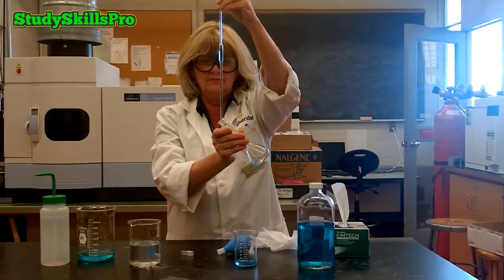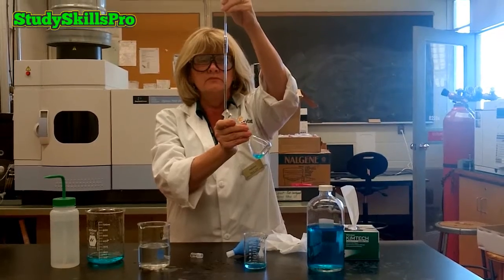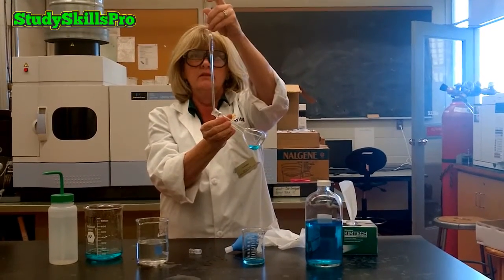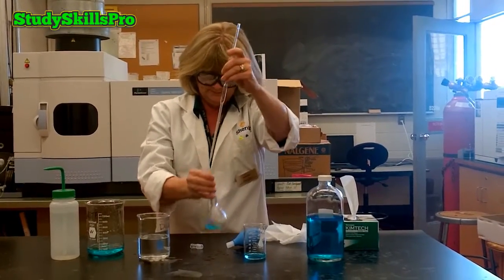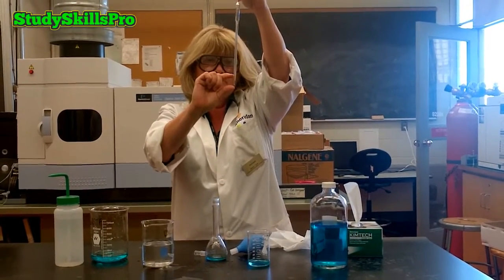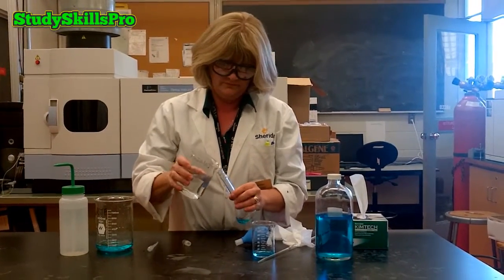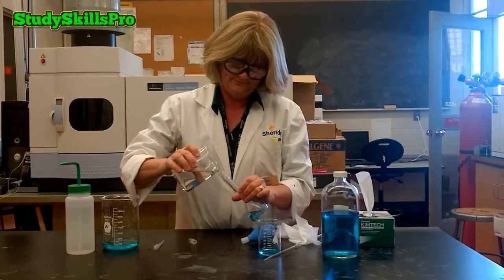In order to do this, ensure that the tip of the pipette is touching the side of the flask. And you will notice here that the volumetric pipette is vertical while your volumetric flask is held at an angle. At the end, you can slowly rotate the volumetric flask in order to ensure that the last drop from the pipette has been transferred into the flask. You will notice that a small volume of solution is always remaining in the volumetric pipette. You never blow this solution out of the volumetric pipette. You are now ready to fill up your volumetric flask.